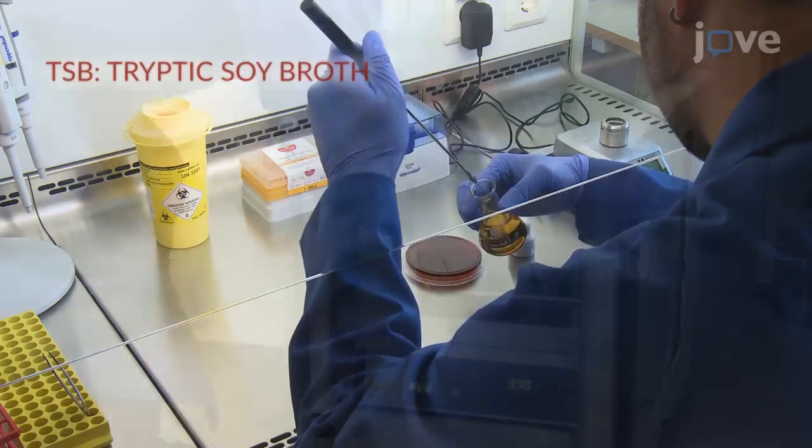The next day, dilute the culture at a 1 to 500 ratio in fresh TSB and incubate the bacteria for an additional period.